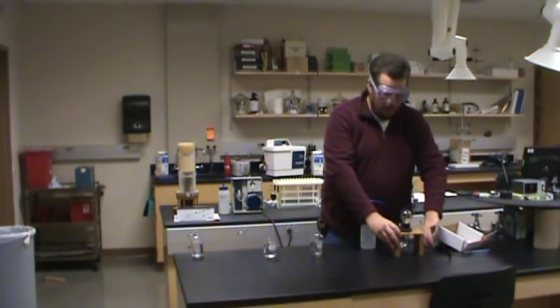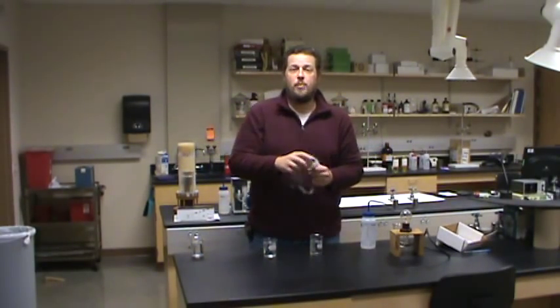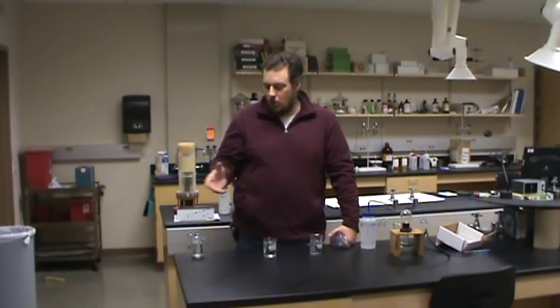That's the basics of our experiment. One thing that consistently causes problems is water choice. There's reverse osmosis deionized water available in the lab — that's clean and doesn't conduct for this experiment. Deionized water has been treated to remove most everything except water, so it's a pretty pure source. The big problem that comes up over and over is that somebody will have data that looks funny, and fairly often it turns out it's because they used the wrong water.